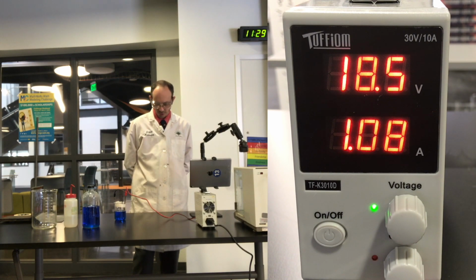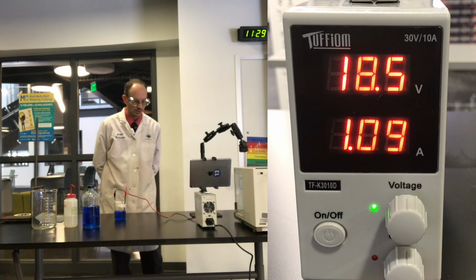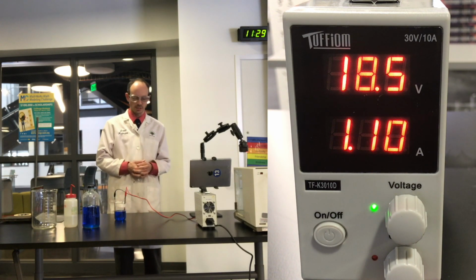I'm getting closer to the time when we're going to shut off the system. We're about 50 seconds away. That'll be about a good 4 minutes of the system running.